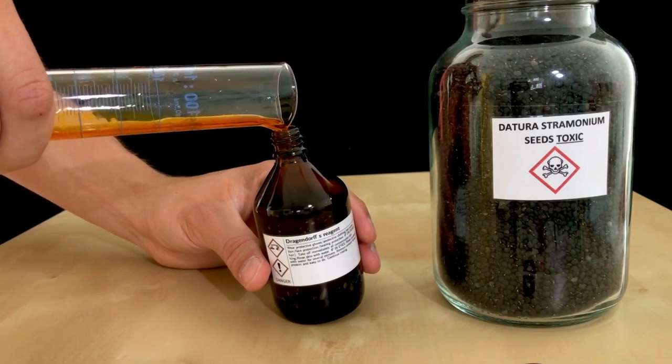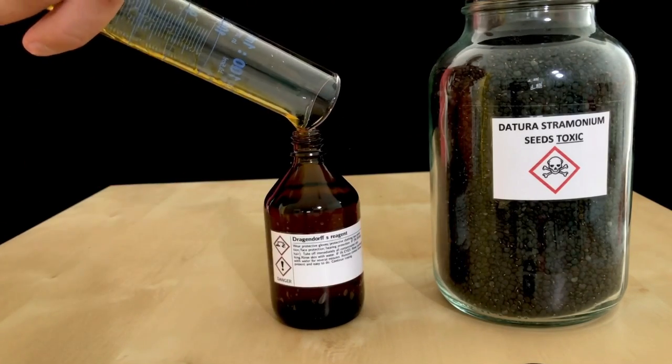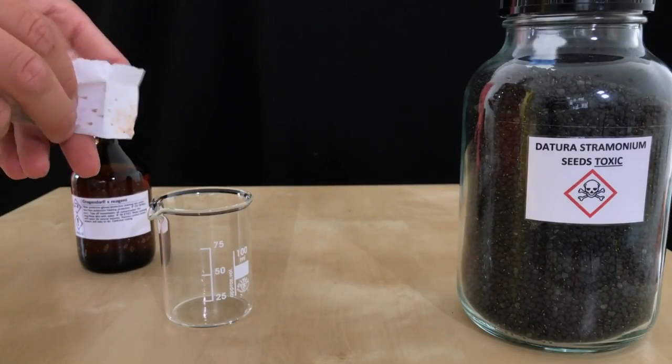The reagent was carefully transferred to a properly labeled storage bottle. Time for the fun part.